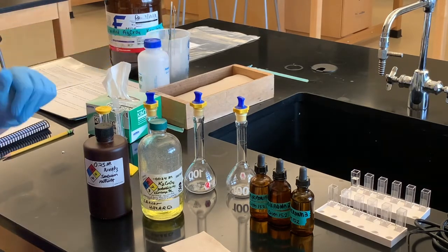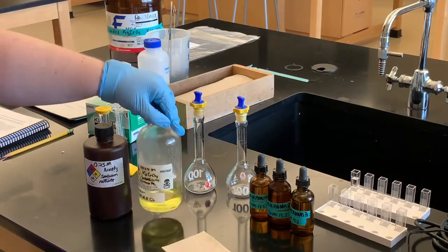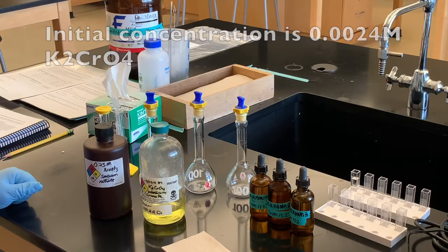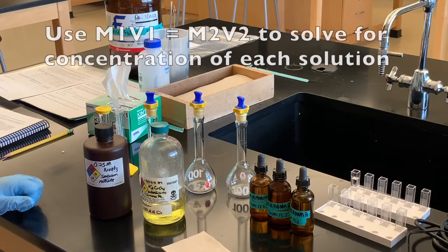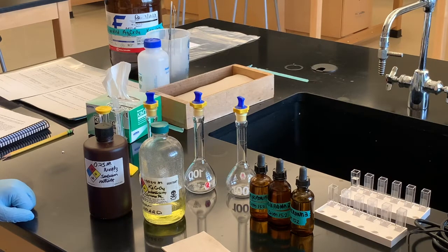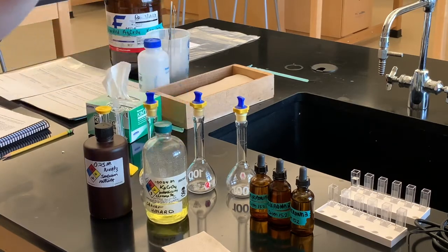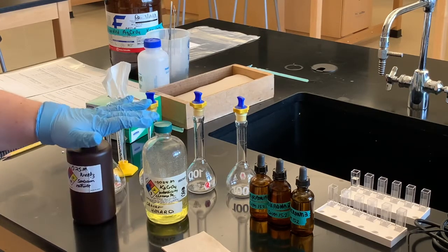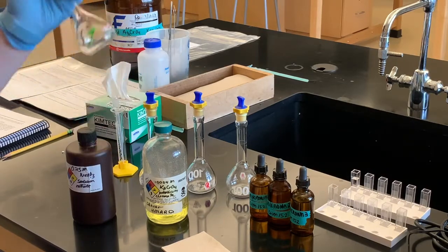To do that, we're going to prepare four separate solutions from a stock solution. Here in this bottle you can see a yellow solution — that's potassium chromate — and we're going to dilute that into four different solutions. You'll use the formula M1V1 = M2V2 to calculate the concentration of each solution. The first one will be one milliliter of the stock solution, diluted with 0.25 molarity sodium nitrate in a volumetric flask so we can accurately measure the volume.